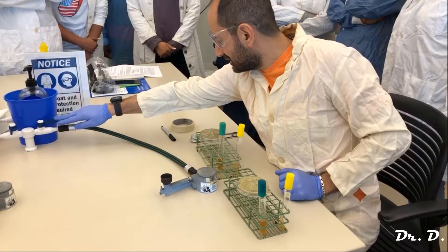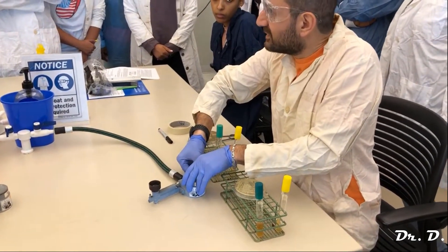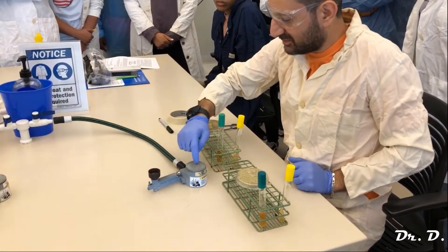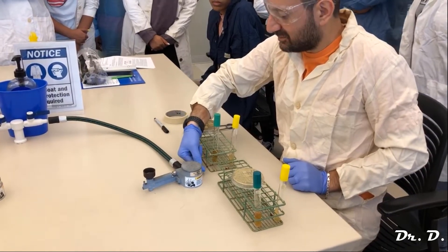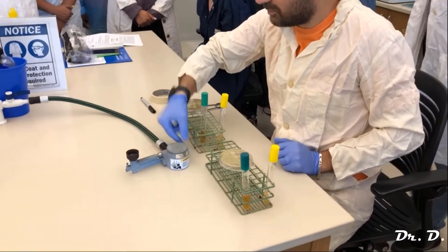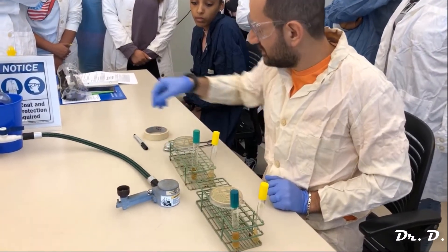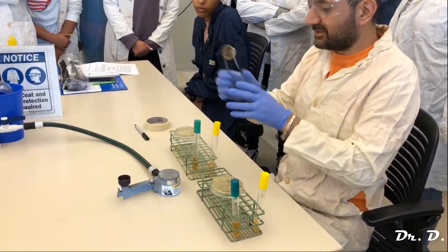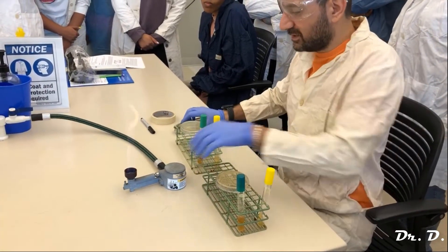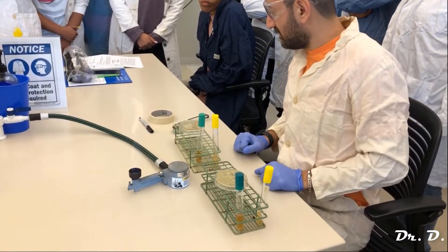Turn on your gas. When I turned on the gas I didn't hear a hiss at first, and now I'm starting to hear one. If you don't hear a hiss when you turn on the gas, something is going on with your Bunsen burner — usually either this dial isn't all the way open or this plate isn't down. Push the plate and turn it. Now I hear the hiss. I've got my striker — push on it, click it — and you've got your flame. You want your flame somewhere close to your work environment.